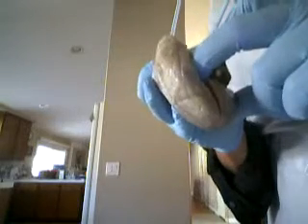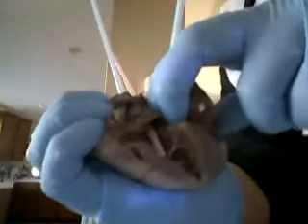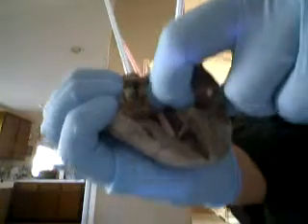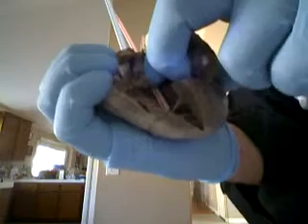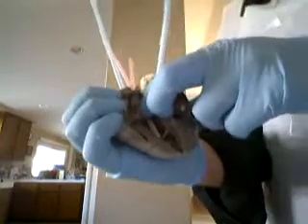And then right here, this where the straw is, this is going through the aortic valve. The valve in here would be the aortic semilunar valve, and that's where the blood goes into the aortic arch.